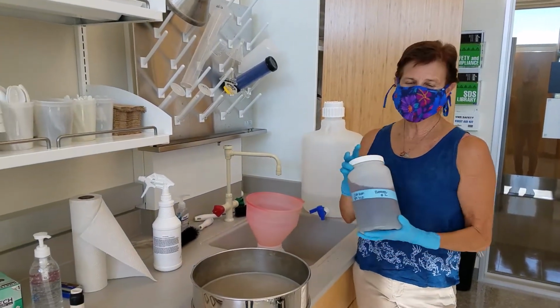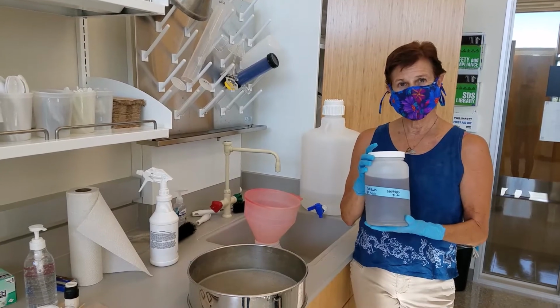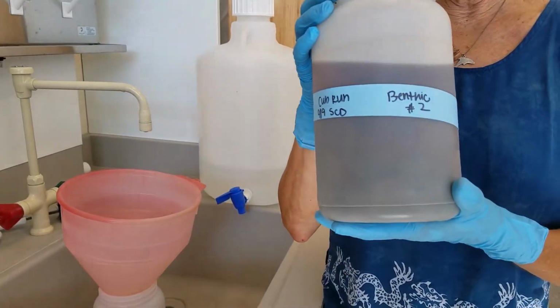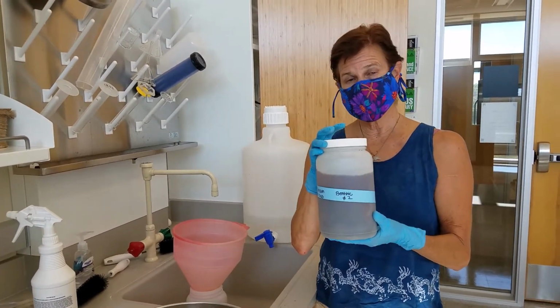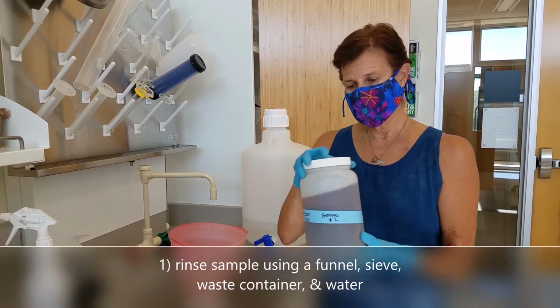Okay, hi all. So we're going to go through the lab processing for benthic macroinvertebrates. This is a stream sample that we collected a few weeks ago from Cub Run. And if you remember, we preserved it in an ethanol solution. And so the first step is to rinse it.